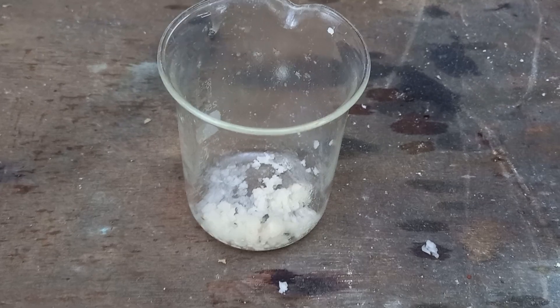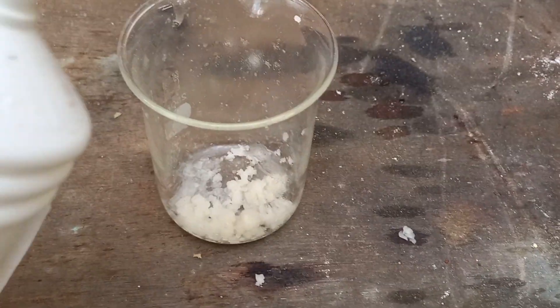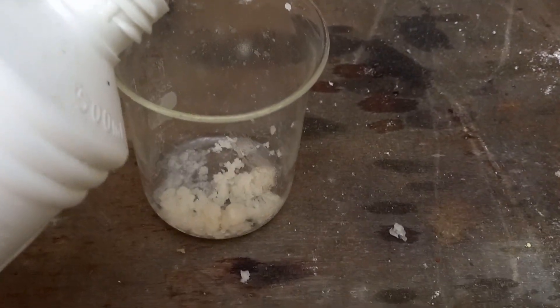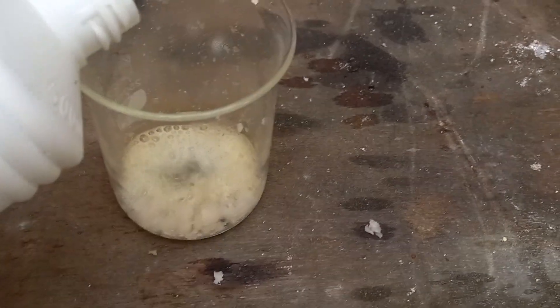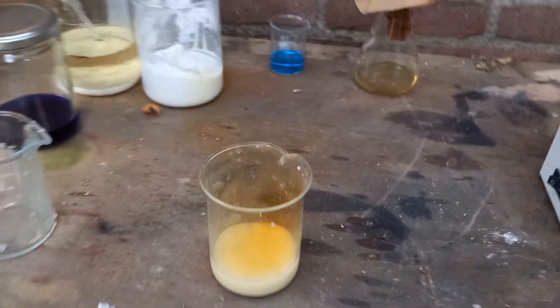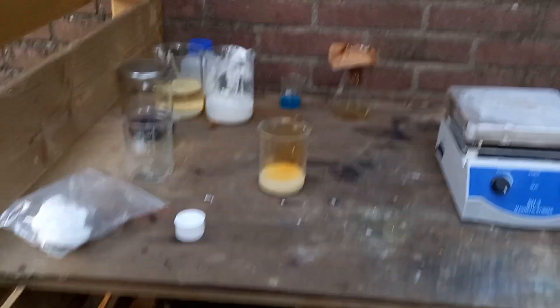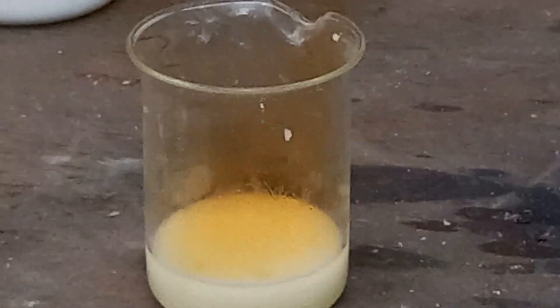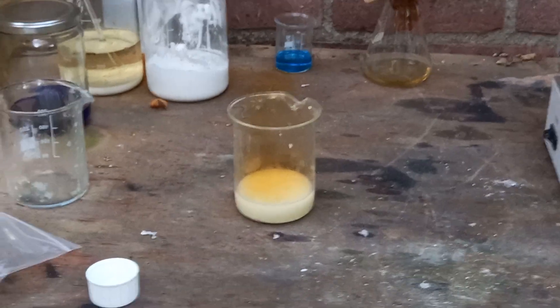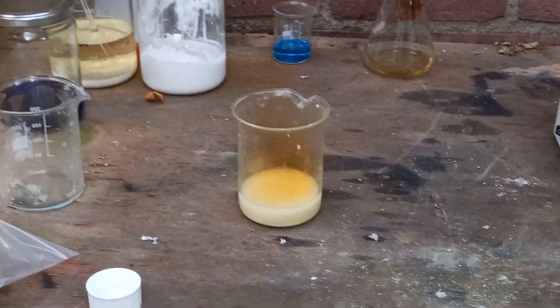Look at that nice yellow solution. I have here some of the filtrate and I was wondering how much of the nitrite is left behind — I'm guessing quite a lot, but let's test that. Definitely some. Don't breathe that in, I can smell it. It looks beautiful to be honest. But yeah, definitely some of the nitrite gets left behind, though less than I expected.